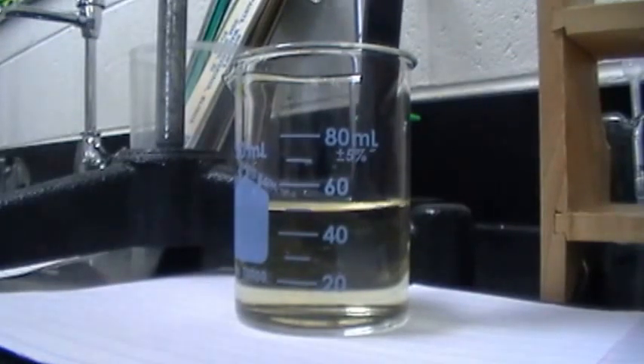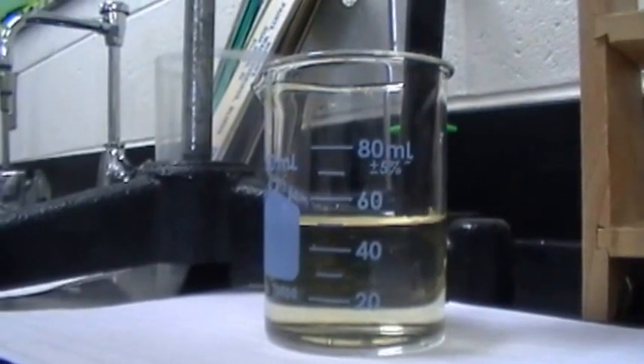Do you want to stir? It's still dropping. As you can tell, our little thing is still dropping. As you can tell, it turns a very faint pink each time a drop enters. Now we're going to stir and check the pH.